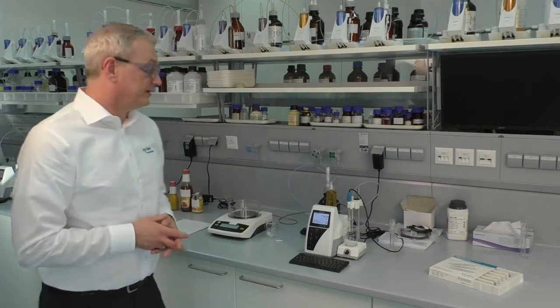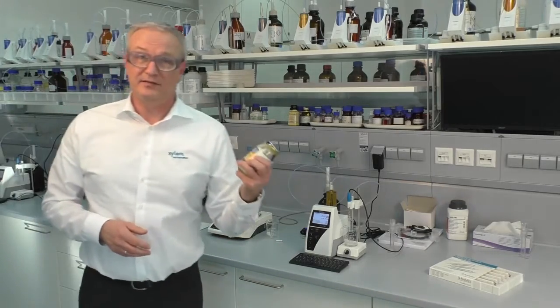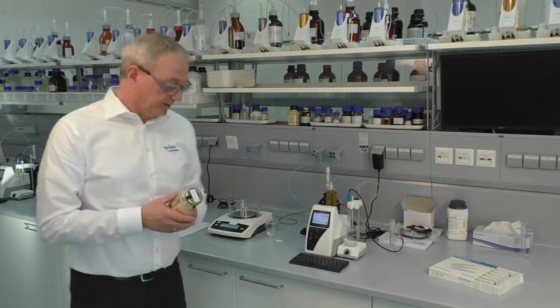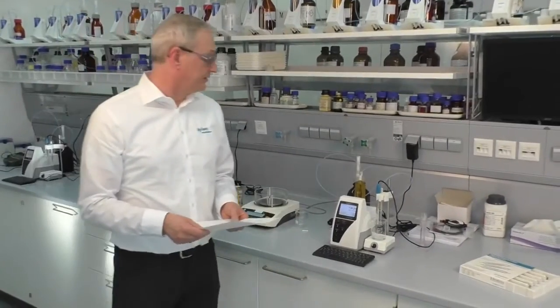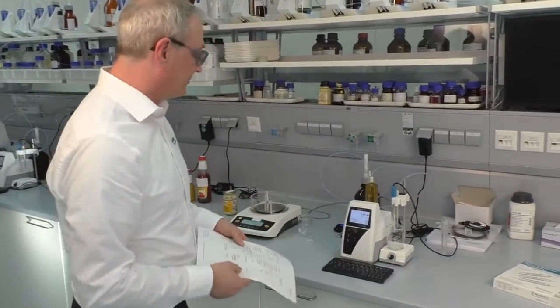In another video we showed you the titration of total acidity in fruit juice, and now we will show you something different. We want to titrate the acidity in a mayonnaise, not a liquid. It's a more solid sample, and the difference is we don't have citric acid as in a juice. We have vinegar, acetic acid, in the sample. We will use the same standard method as we use for the juice, but we will change the parameters. We have a few application notes, so we can use the parameters from the application note.